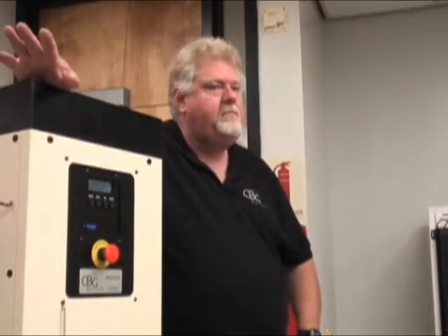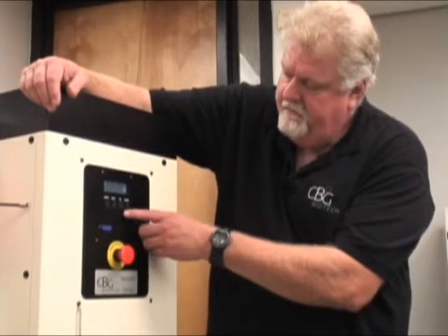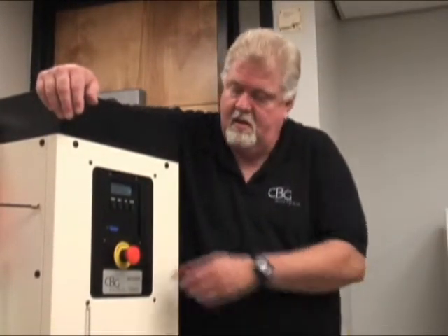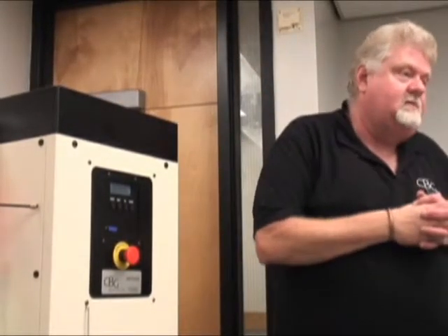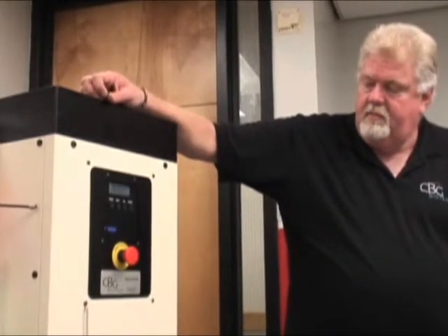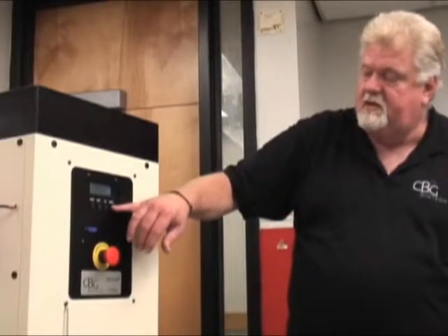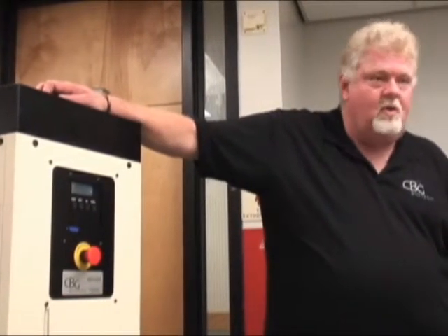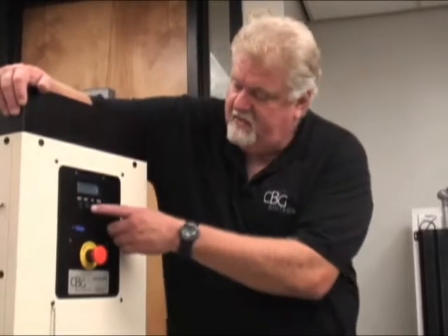Just like before, it'll open the waste drain, dump whatever it can — recycle the waste, water, inks and dyes, and trace amounts of alcohol — then close, and the cycle is done. If you were to reset this machine and run more alcohol, I recommend you run your alcohols together. If you reset and went through the whole gamut again, it just starts, because you've already flushed. When you go back to xylene, there's no flush. The last thing to show you: what happens if the power goes out? Power goes out, power comes back on — you'll see 'press enter to finish the current cycle.' Press enter, and it says enter to finish the run or no to drain the unit. If you believe there's about a gallon left and it's been cold, just press enter and it'll restart itself, saving you from having to redo it all. If you believe it's almost done, just drain the system and start it up again. It'll finish off the cycle, and this works in xylene mode too.